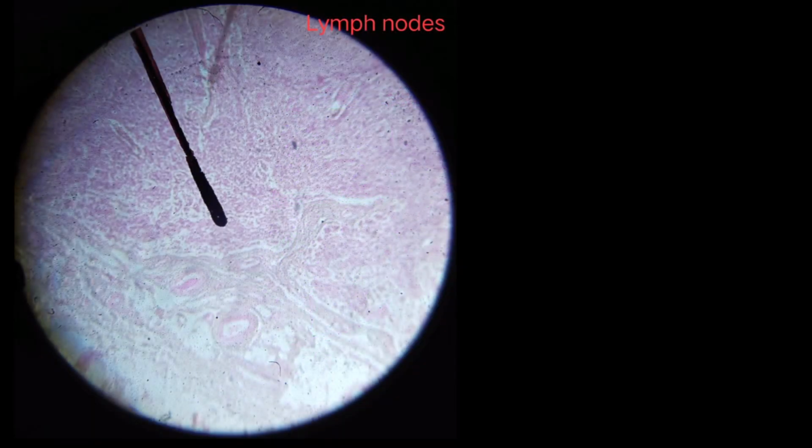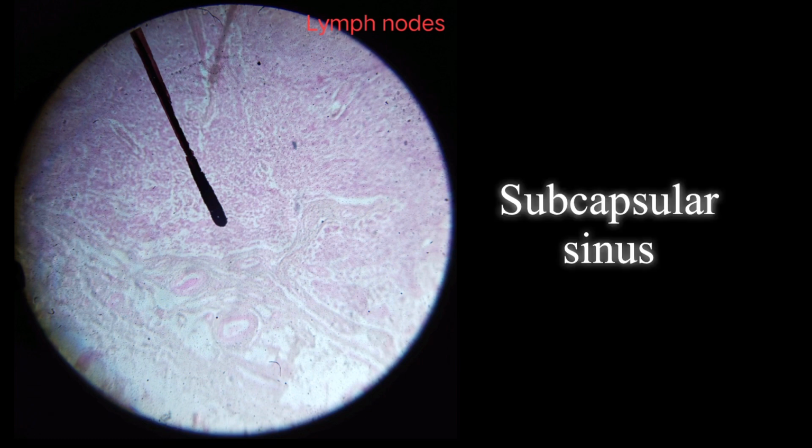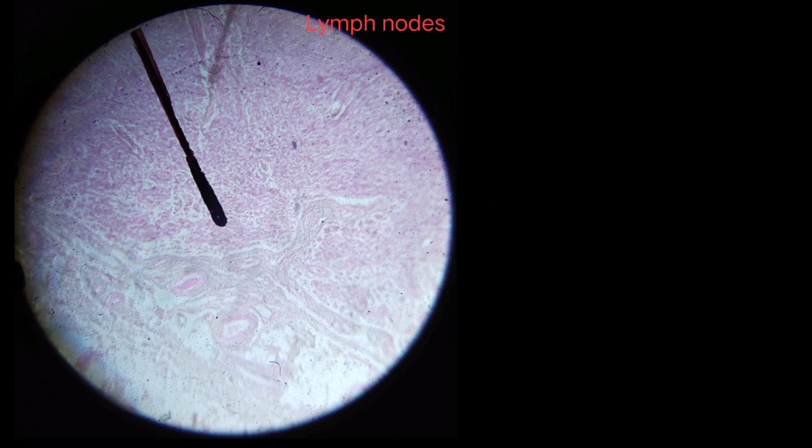Points of identification when seen under the microscope. A thin capsule surrounds the lymph node and it sends in trabeculae. Just beneath the capsule, we can see a clear space. This is known as the subcapsular sinus.